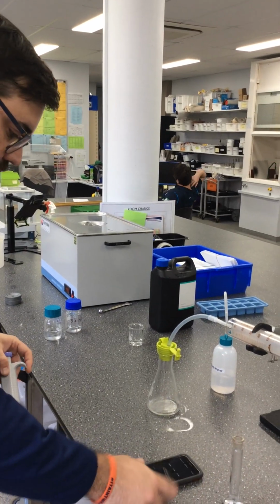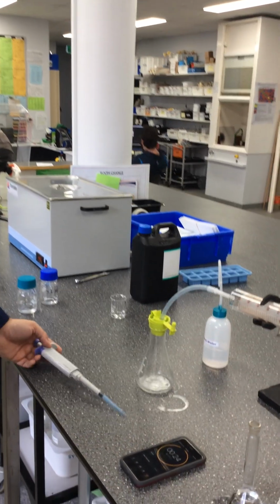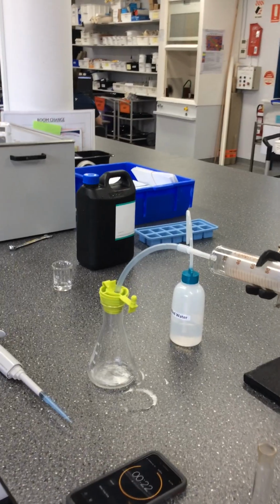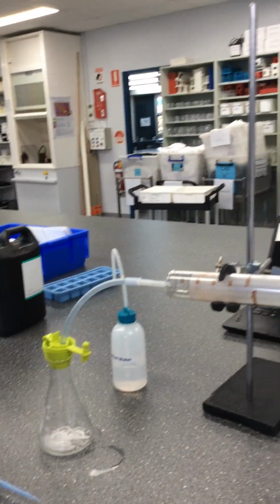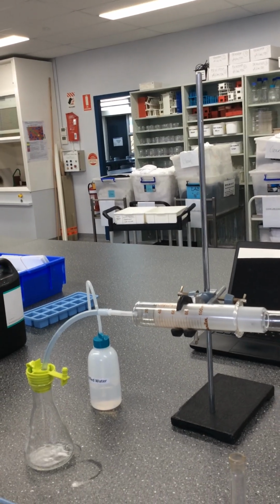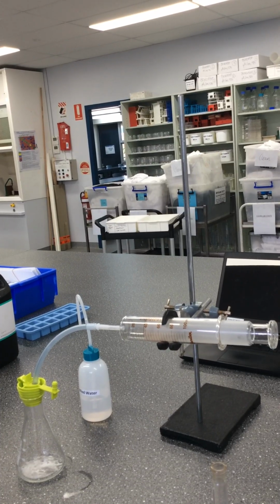Oh, I didn't start the timer. Oh no. All right, this one might be a little bit off. That's why having multiple people helps. But you can see that we are already at just over 30 and we're halfway through. So we're already eclipsing what we did previously.